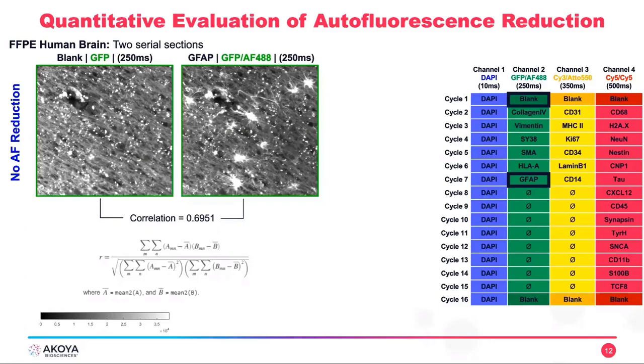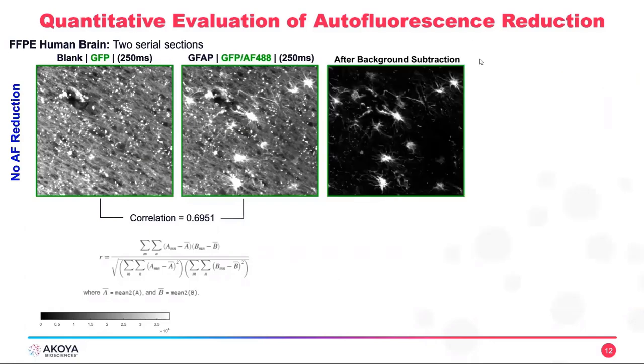But the good news here is that our background subtraction algorithm is still able to extract those astrocytes from this image by removing the background found in the blank image from the GFAP image. But as you can see here, we still have some pixels that are bright, that's coming from the noise that we have in the background. For example, this dot here, which is just high autofluorescent pixels. And to measure this, we can draw a line on this image, and we measure the intensity in each pixel along that line.